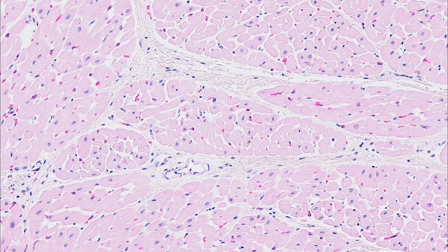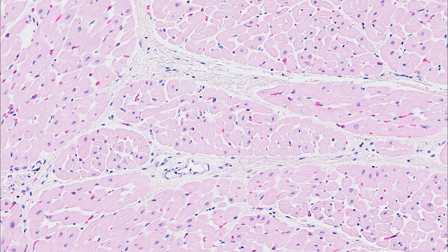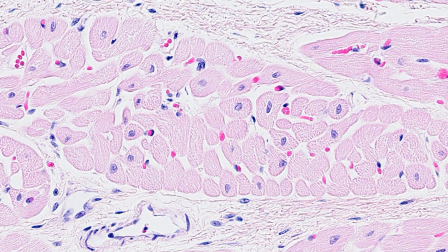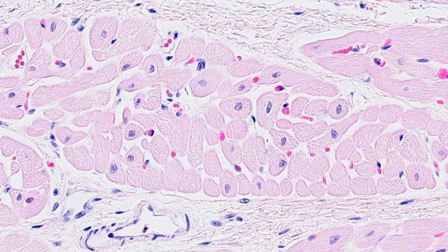Let's briefly examine cardiac muscle in the transverse section. Here you can see individual cardiomyocytes, some with visible nuclei. You can still spot the contractile proteins in the cytoplasm as bundles of eosinophilic material. However, it's harder to see the multinucleation or the branching characteristic of longitudinal sections.